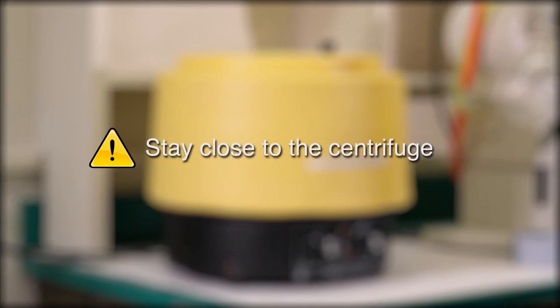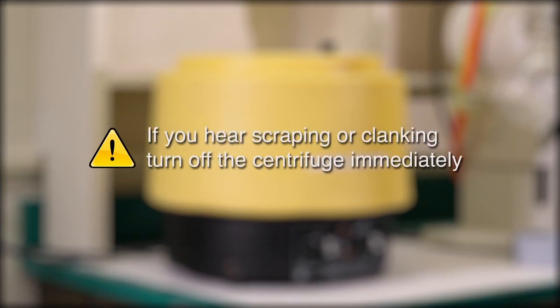Stay close to your centrifuge till it has come to full speed. If a scraping or clanking noise occurs, or the centrifuge starts to wobble, turn off the centrifuge immediately.